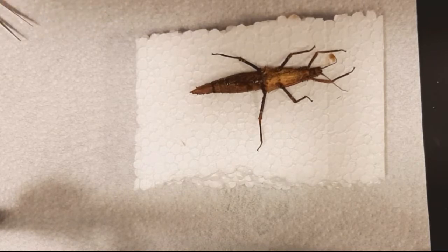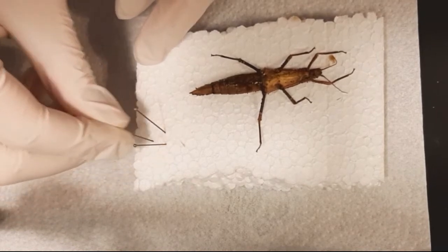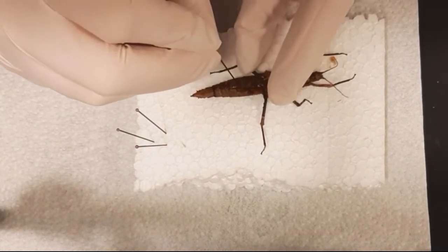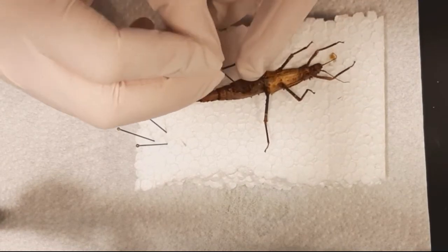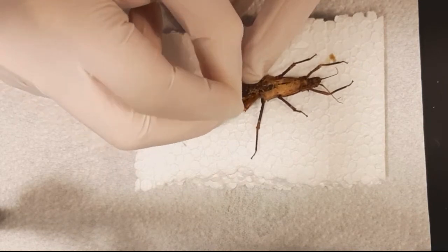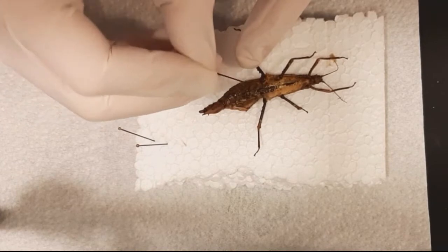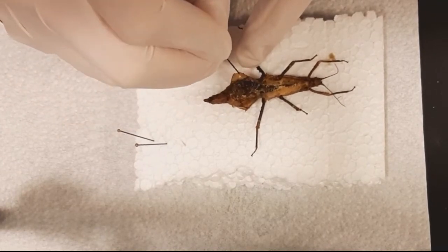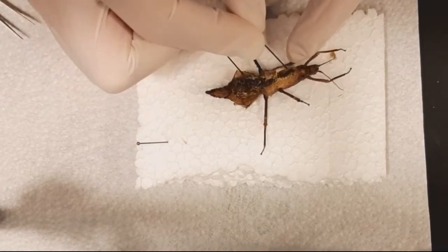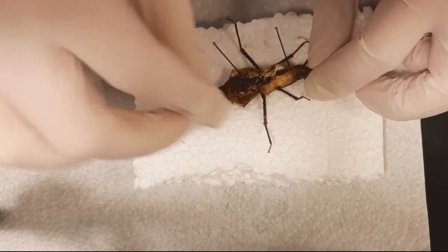you can open the insect with your fingers — you don't need anything else. You might have tweezers that are open in rest position that you have to force close to keep it open. Here I will use needles simply for the sake of the video. It will leave holes in the bottom of the exoskeleton, but in a display case you won't see this. If you want a complete three-dimensional structure for study, then this won't work.